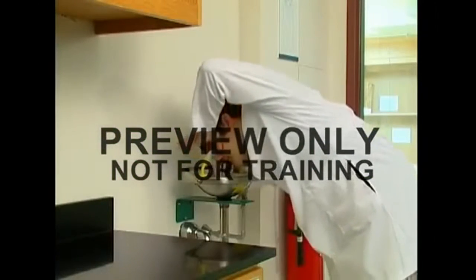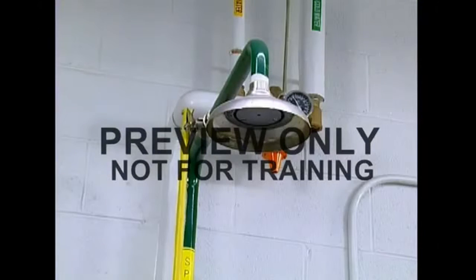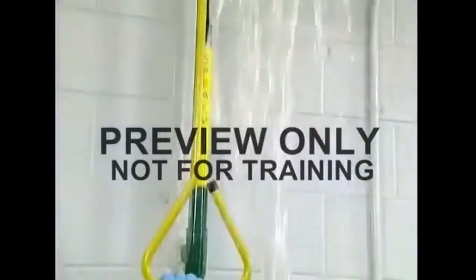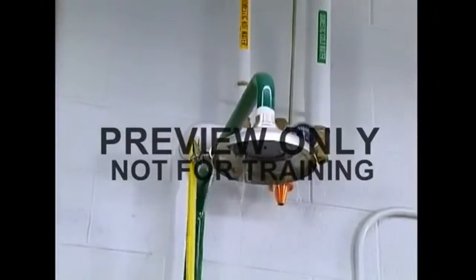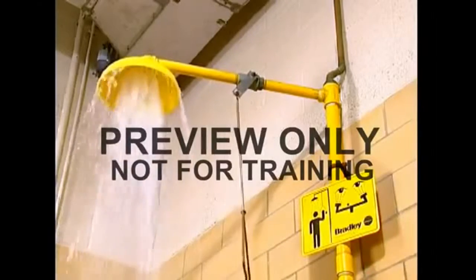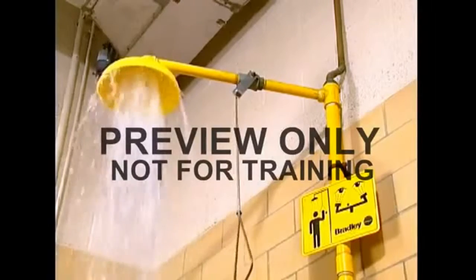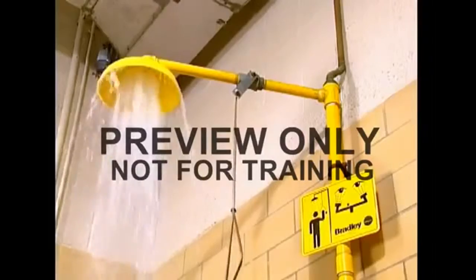There are several types of safety showers and eye wash stations. The best are simple. With one movement, the water starts to flow. The stream continues until a second movement is made to turn it off. The flow of water in a safety shower must be strong enough to immediately drench the victim. The unit should also provide enough water for at least 15 minutes of continuous use.